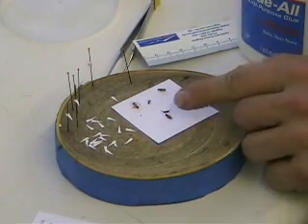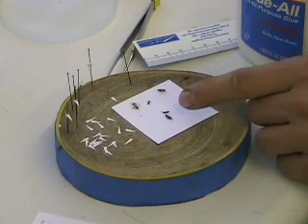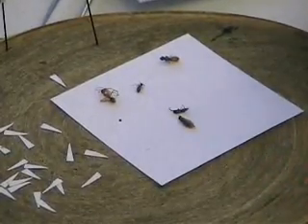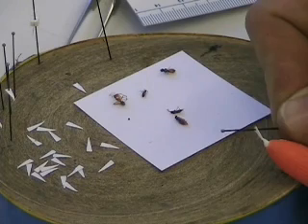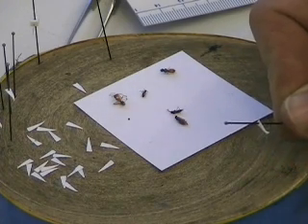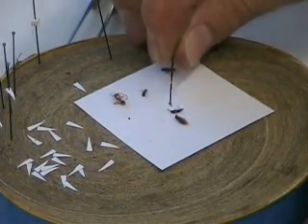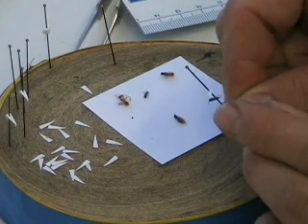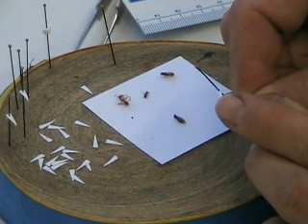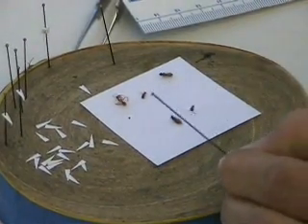With your specimens, you want to make sure all your specimens are leaning on their left side so their right side is exposed, making it easier for you to stick the point on the specimen. Add a little bit of glue to the point. You can use Elmer's glue — regular Elmer's glue is fine. Don't use super glue because it dries too quickly. Elmer's glue has a thick consistency so you're able to stick your specimen on there much easier. Then stick the point right on the right side of the thorax. If the specimen is not sitting just right, carefully manipulate it and give it a gentle blow to dry it on the point much quicker.